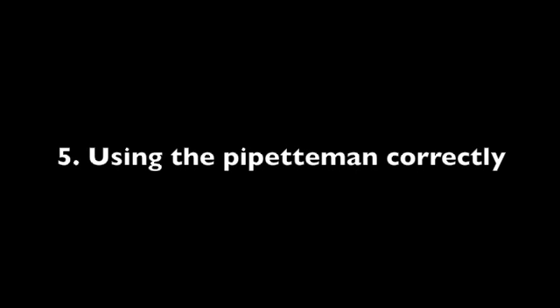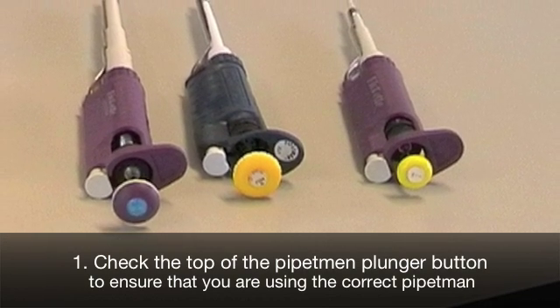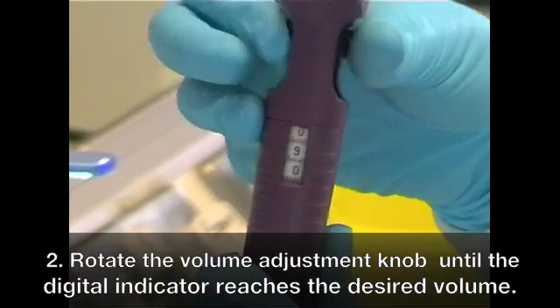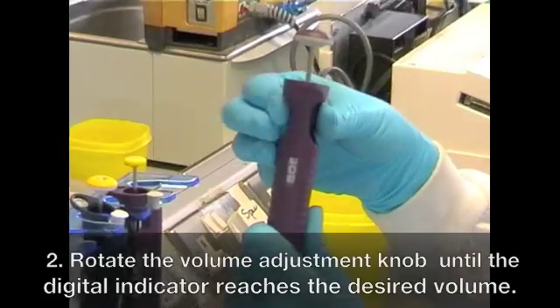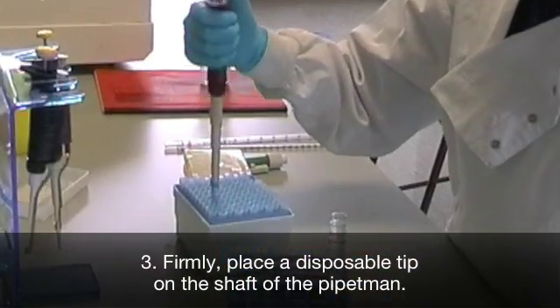When using pipetmen, there are a series of steps you should follow to ensure accurate pipetting. First, check the pipetman plunger button to make sure you are using the correct pipetman. Step 2: rotate the volume adjustment knob until the digital indicator reaches the desired volume. Then firmly place the disposable tip on the end of the pipetman.